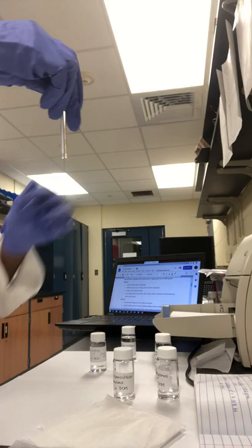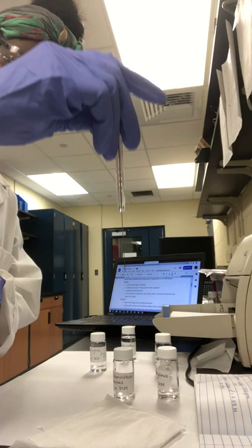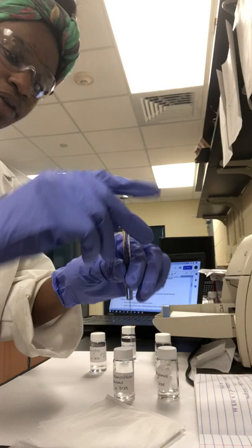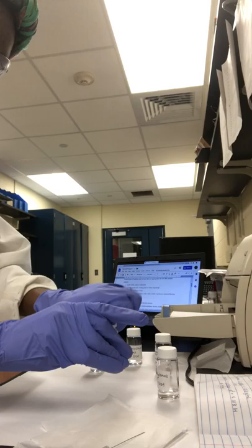We're going to prepare our syringe for injection of the sample into the injection port. We want to pick a syringe that has a very straight needle so that we don't damage our injection port when inserting our sample into the GCMS instrument. We want to pull up the plunger to see if it moves freely and if there's any blockage — it looks like there's none. Then we want to make sure our syringe is clean by washing with our intended solvent, which is dichloromethane in this case.